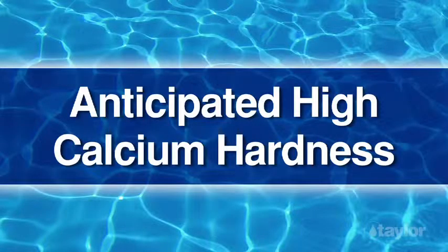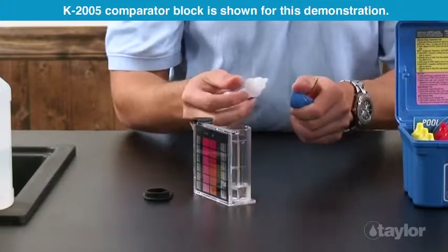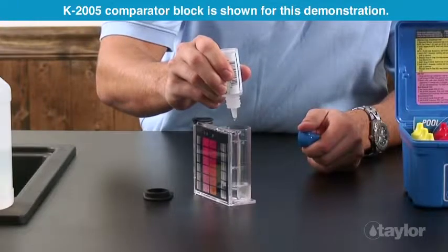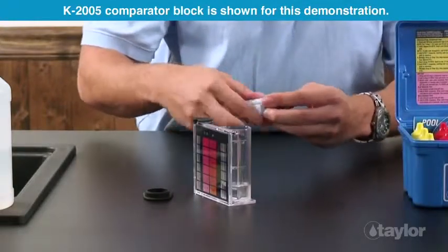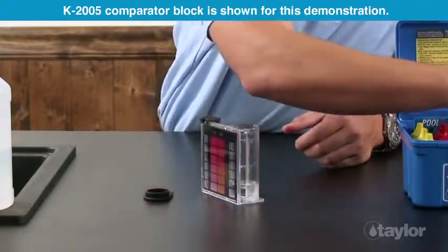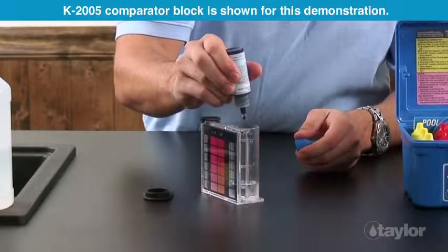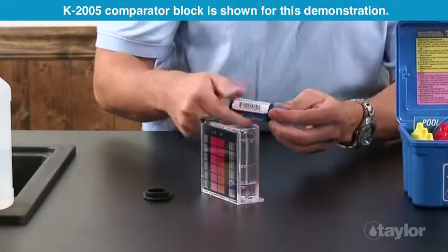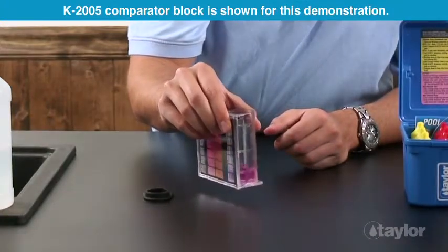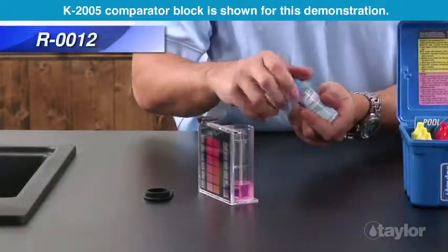When high calcium hardness is anticipated, this procedure may be used. Use a 10 ml sample, 10 drops of Reagent 10, and 3 drops of Reagent 11L. Multiply the number of Reagent 12 drops used by 25.